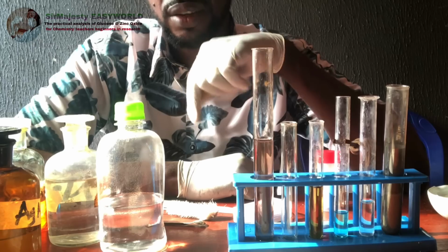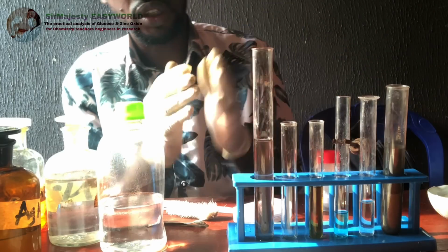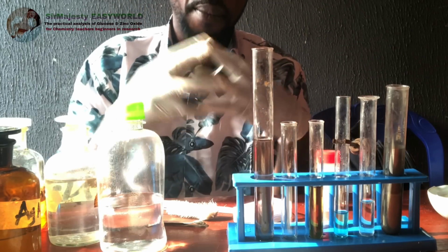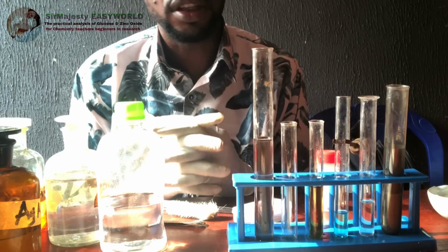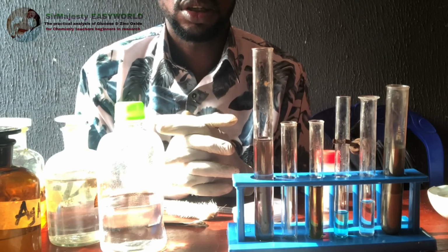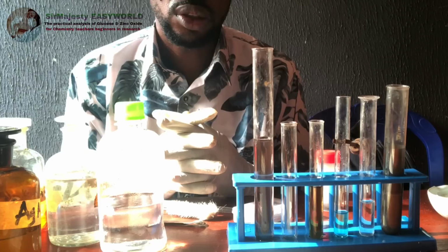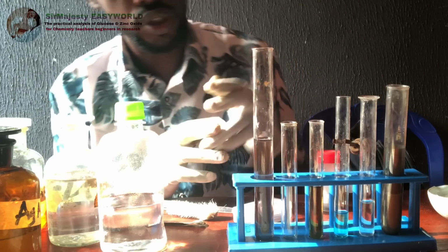So it is still that same zinc oxide. But I'll show the difference between you, because some of you might go there and buy the wrong zinc oxide. Buy the zinc carbonate. If you use the heat test, it automatically turns yellow on heating, and then on cooling turns white. But how do you know zinc?